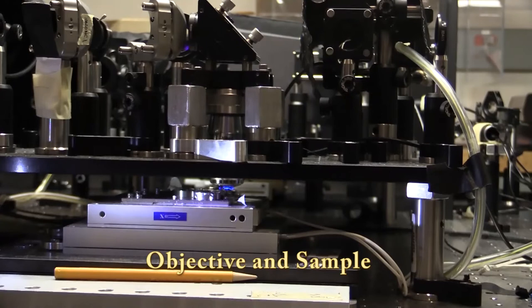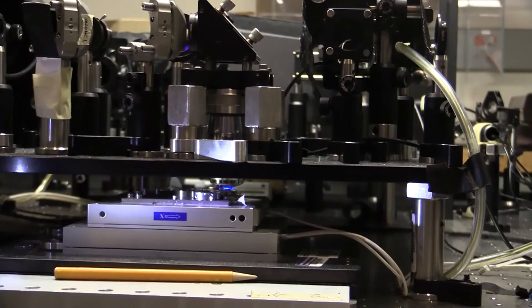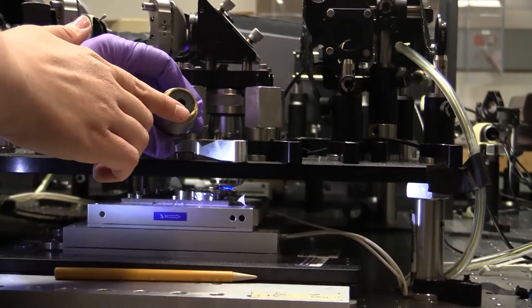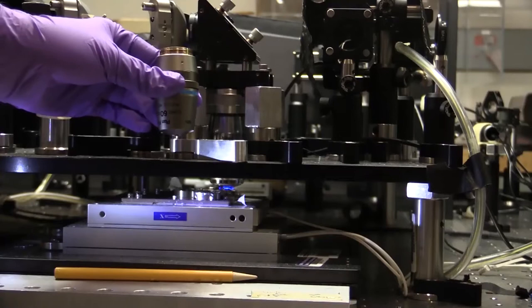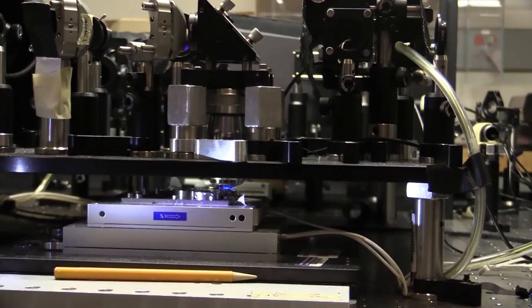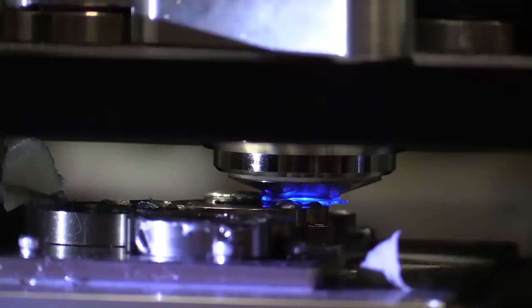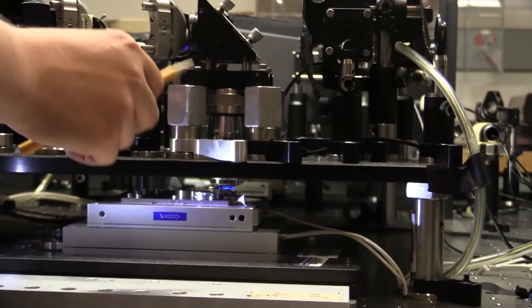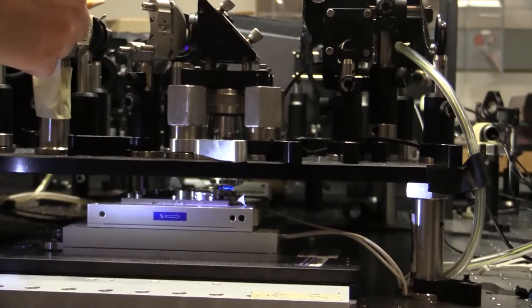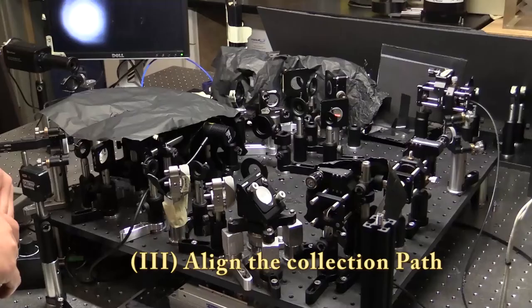Once you have your two irises set up and your beam going directly through them, you then have to get your beam to your sample and through your objective. Here is my objective and down there is my sample. It's important that you have a way to get your beam centered onto the back of the objective and going straight through it. It also needs to be close enough to your sample — about one working distance of your objective away. This can be difficult and your alignment procedure will be different for every particular setup. Once your beam is going to your sample, it will then often emit or reflect light. This is what you're going to be collecting, and it's going to come out roughly collimated from your objective. It's then important to have a filter that will remove your excitation beam but allow your photoluminescence to get to your collection path.